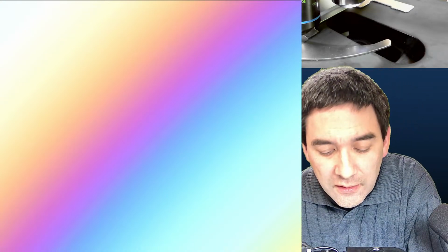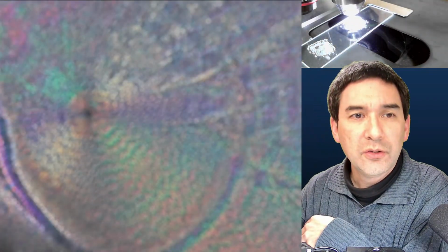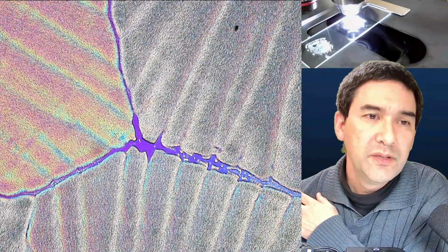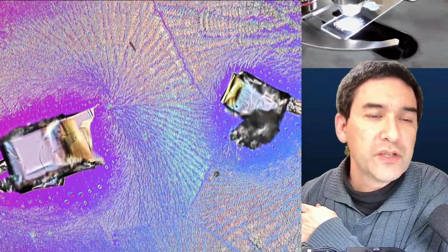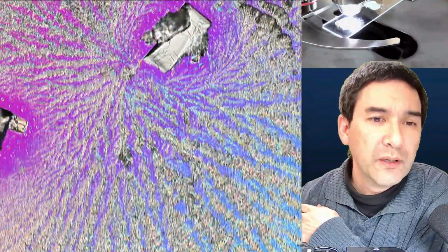I'll put a label number 2 on here so that I do not confuse this. And then the one that I made in the morning looks like this. Let me put this back in again and turn up the light intensity here. You see that these are very flat crystals that have formed. Depending a little bit on the amount of citric acid and the speed of crystallization, you do get different patterns. Over here, I've tried it a second time as well. You see that there are still some non-dissolved crystals, and you can also see that new crystals started to form on the slide itself.